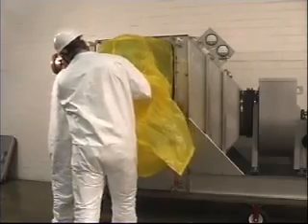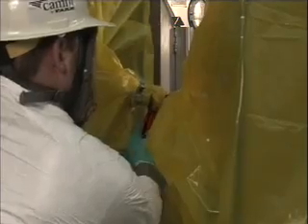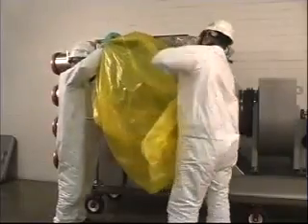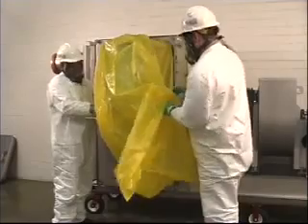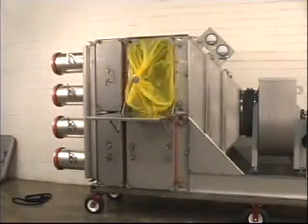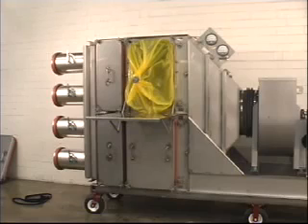Pull the next filter inside the new change-out bag. Band and cut the bag as before, leaving a stub bag on the bagging ring. Repeat these steps until all the filters are removed from the housing. You should have a stub bag remaining on the bagging ring after all filters are removed. Always use a new change-out bag for each filter being removed from the housing.